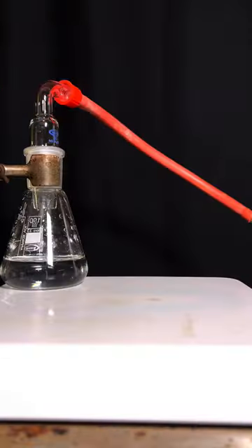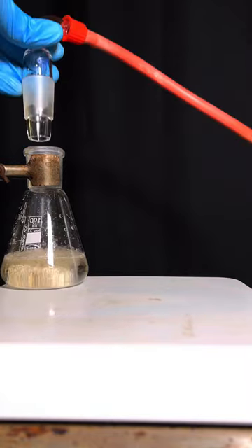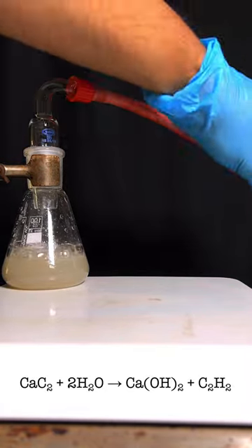By this time you might have understood what it is. This is calcium carbide. Calcium carbide reacts with water to produce acetylene gas.